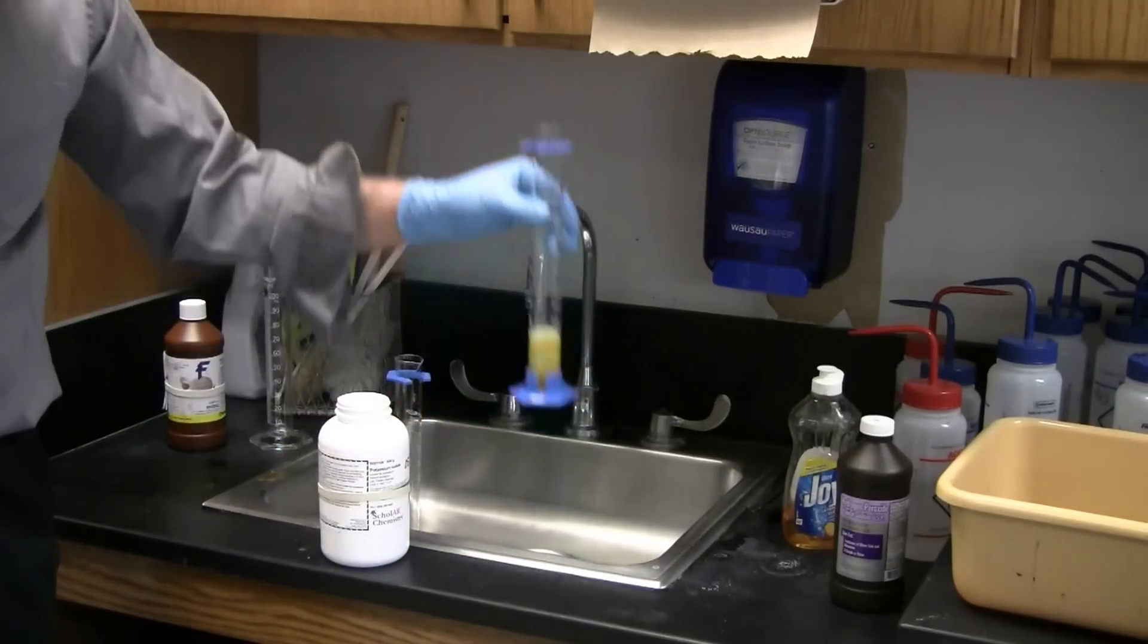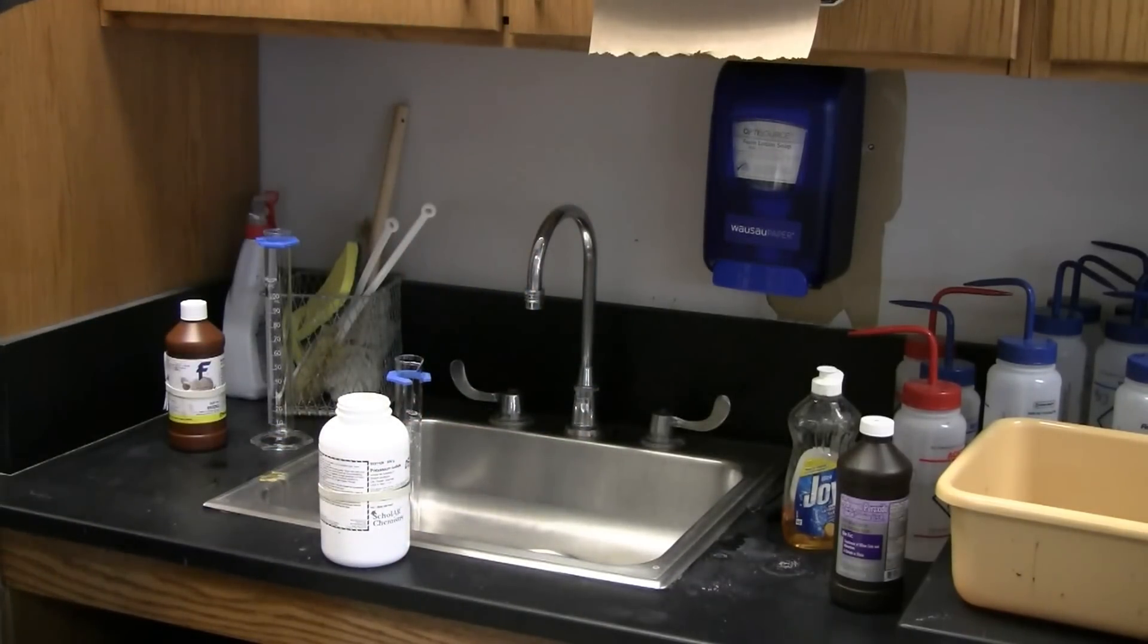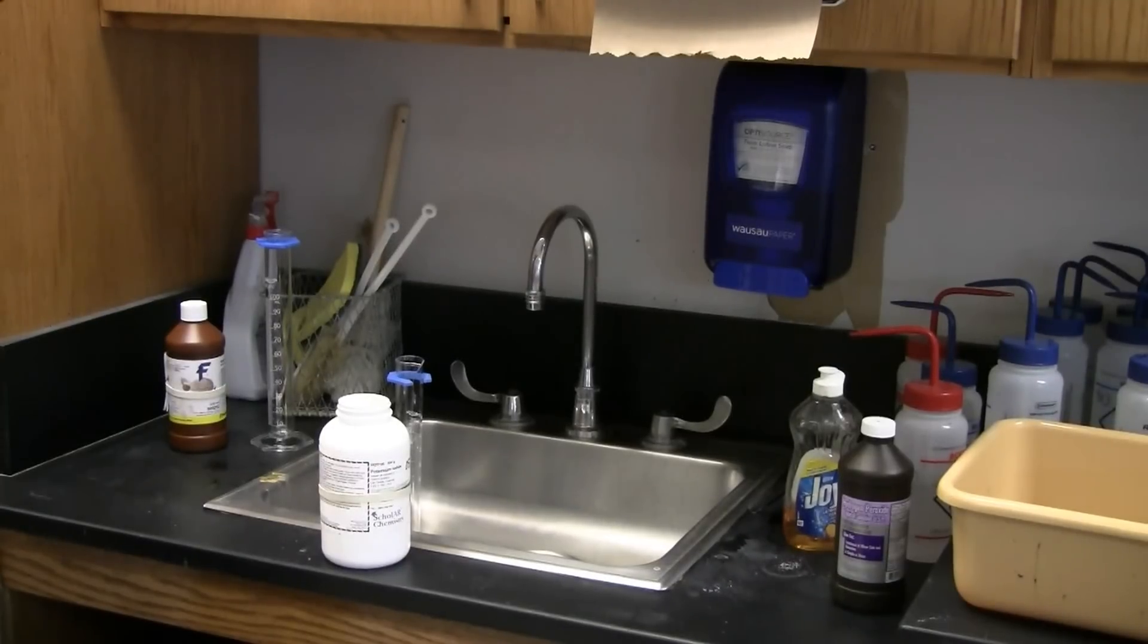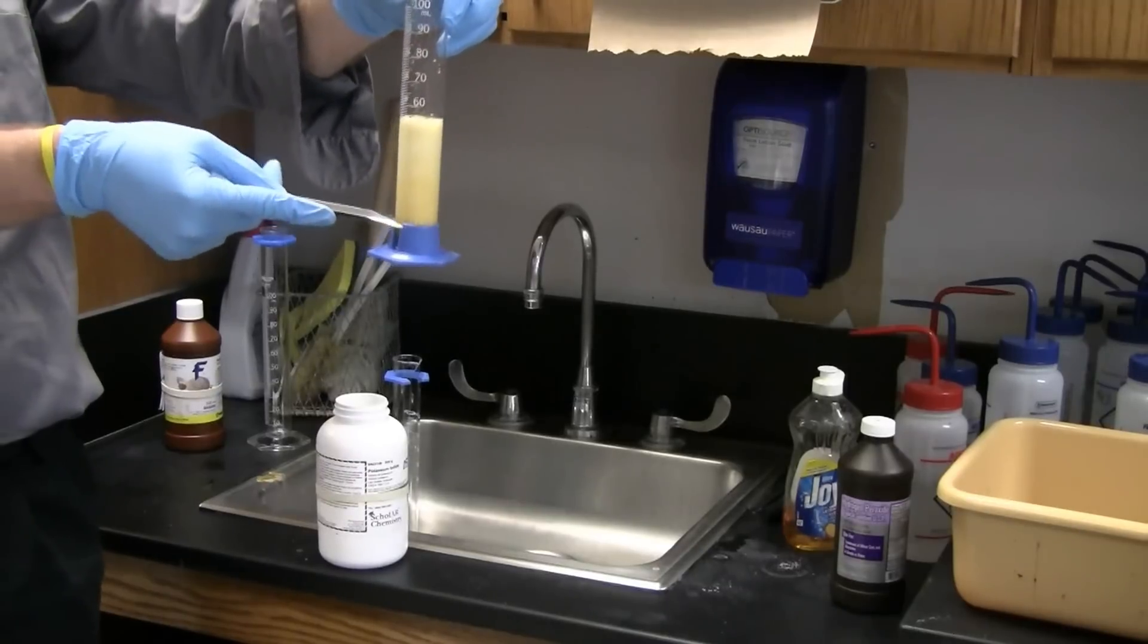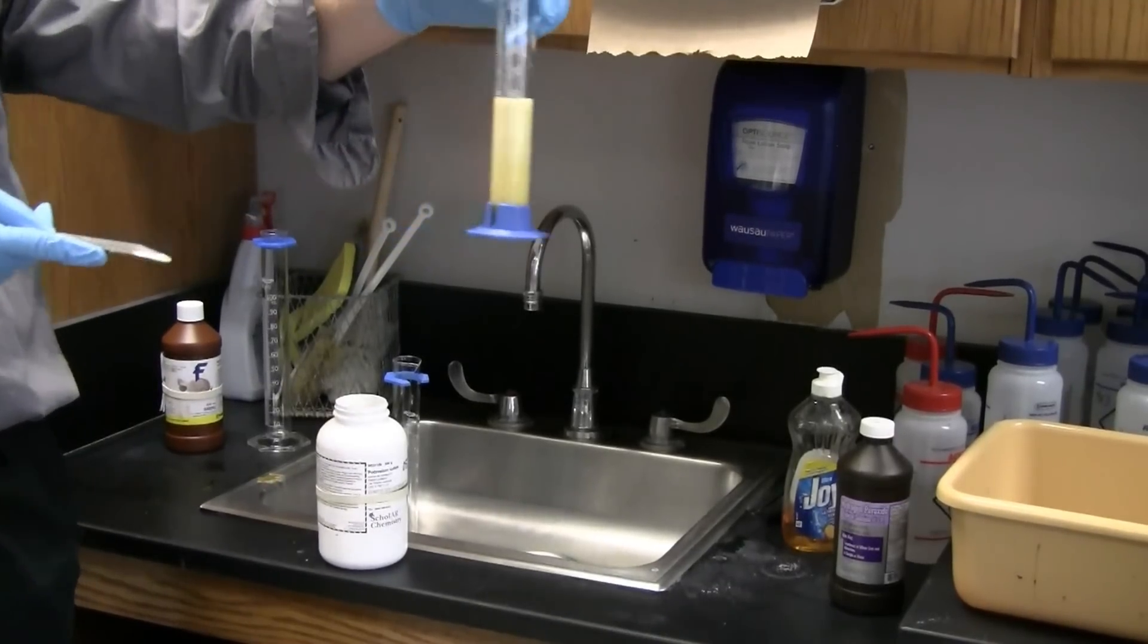So you can kind of see it starting to change a little bit. Probably don't want to drink that. It's a little poisonous. You better put that back in place. It's a little poisonous. So you can see it's rising, nice and slow.